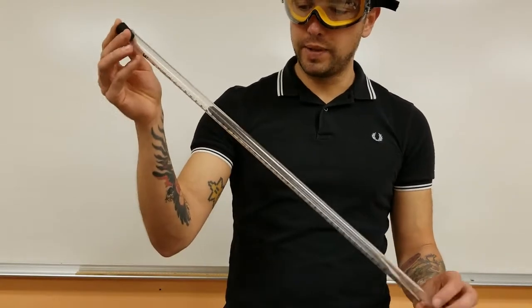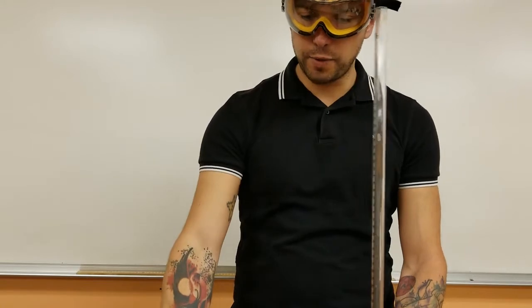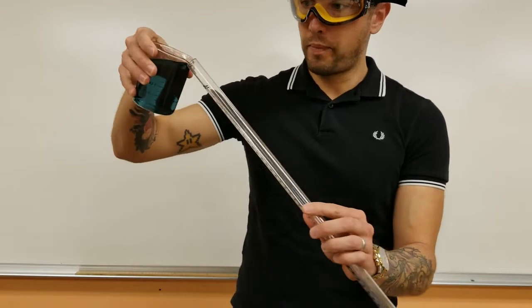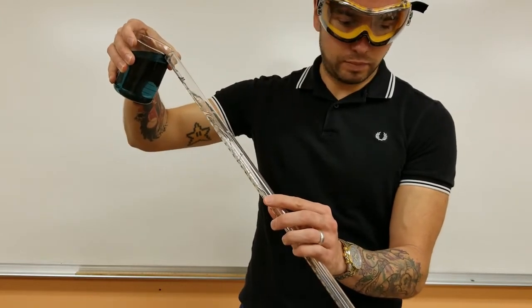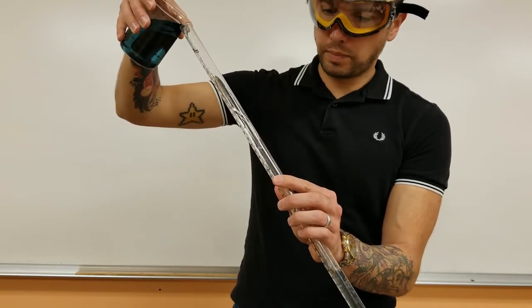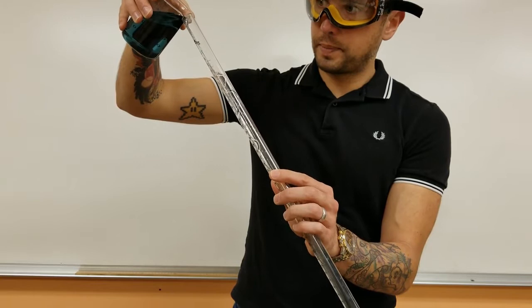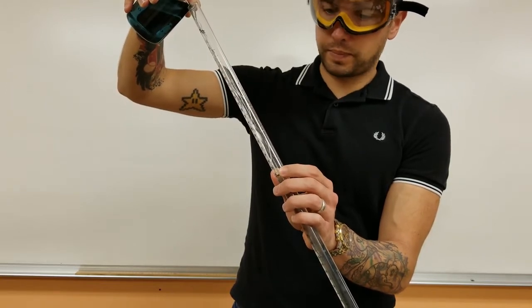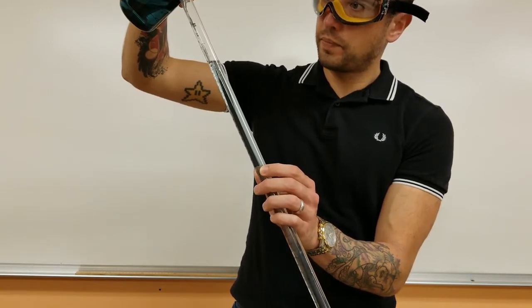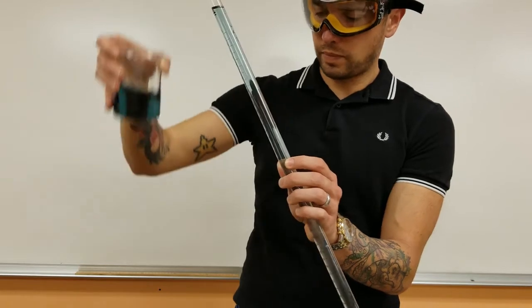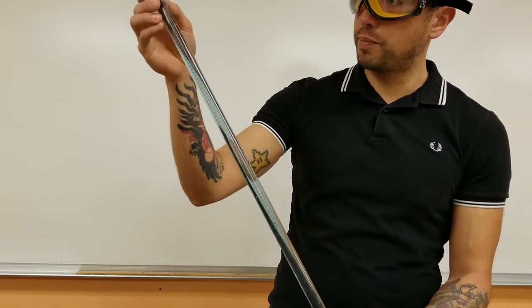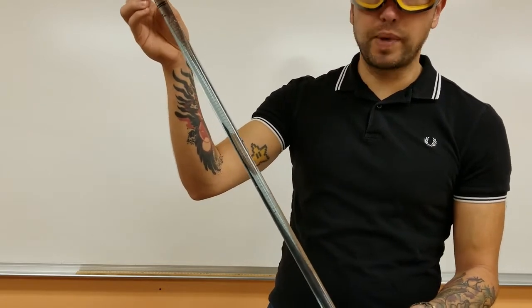What I'm going to do is I'm going to put all of that into this tube. So again, this greenish-bluish color means that it's pretty much neutral.